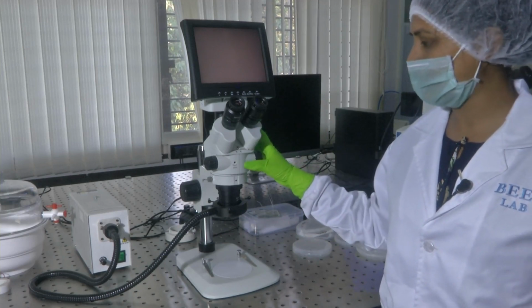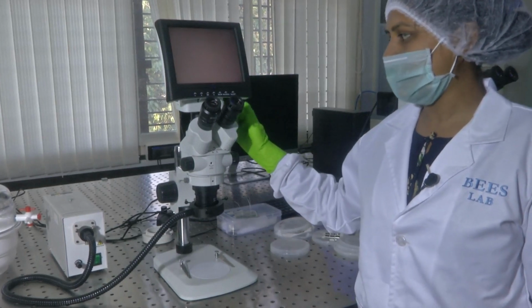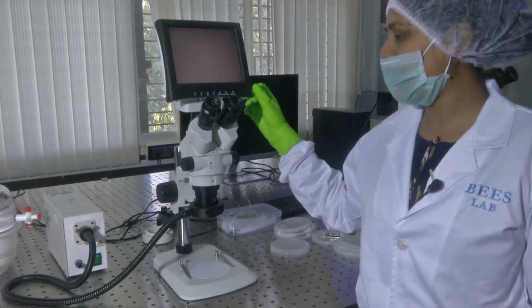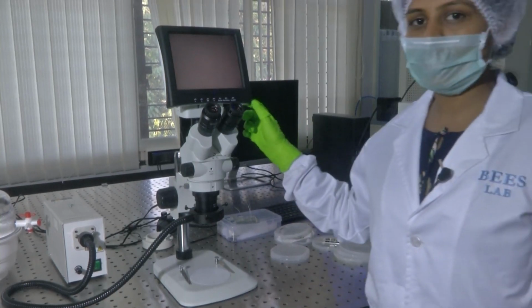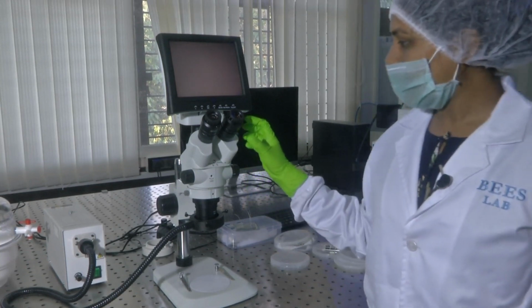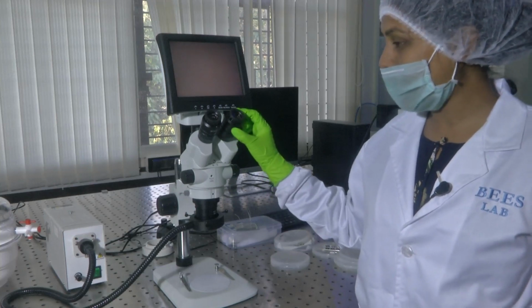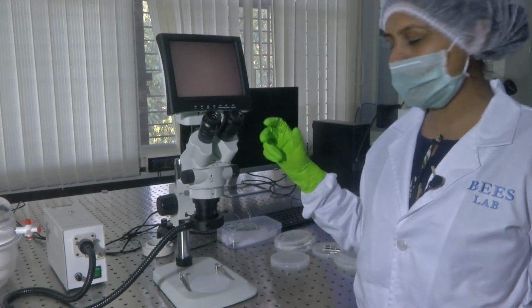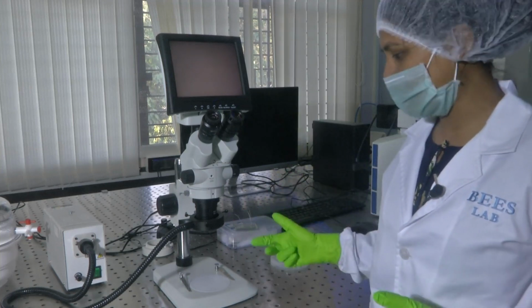In this case, the stereo microscope we have has a display attached to it and a camera. This is optional; for a better view you could always have a camera with a display, which is easy when you are trying to manipulate or study the sample. Now, as you can see, there are these two eyepieces, which enable us to decipher the depth; it gives us the depth profile of the 3D image.